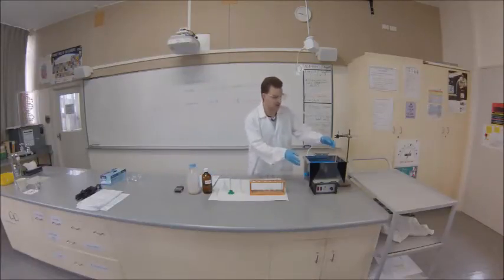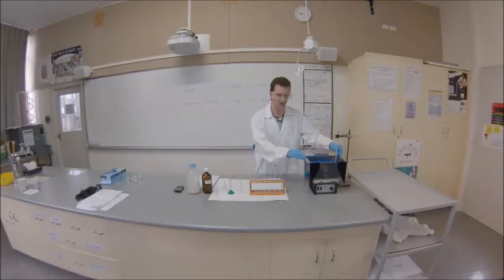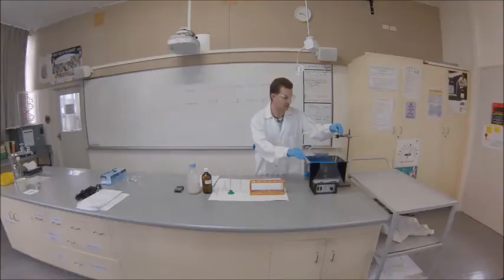Finally, we've got a water bath set to maintain a constant temperature. We're setting it to 40 degrees Celsius because that's the optimum temperature for yeast respiration. We've also got a thermometer to monitor the temperature and make sure it's correct.